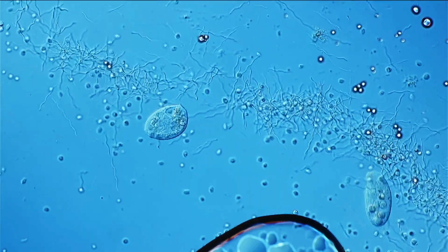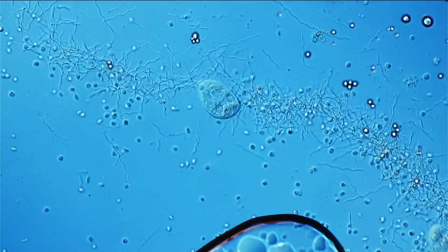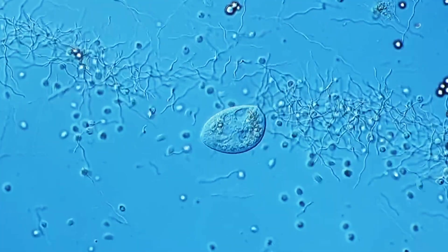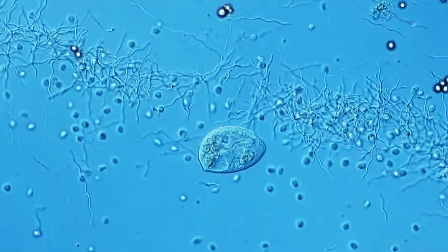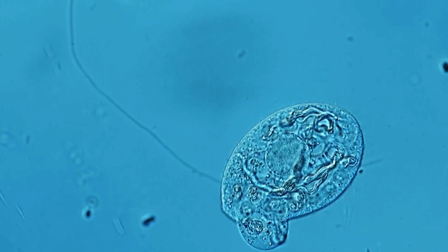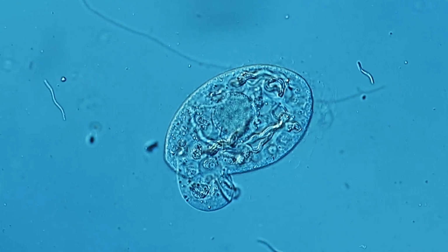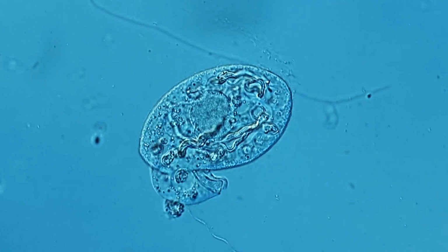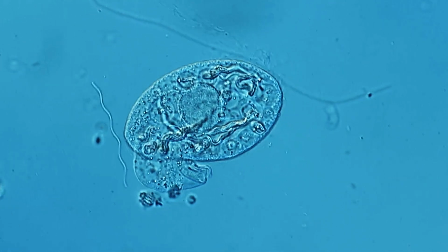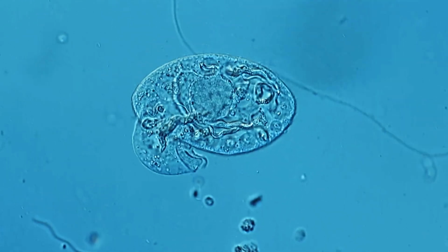So now what actually happens to the larger cells, like for example those ciliates over here? They are significantly larger, they're feeding on those tiny bacteria, but when they're exposed to the hand disinfectant, well, then they do not immediately recognize that the environment has changed. The reason I think is because it does take the disinfectant a little bit of time to actually diffuse into the cell. So first of all, this ciliate was happily moving around trying to feed off the bacteria. I think they're too large in any case, but I think that's a different topic.